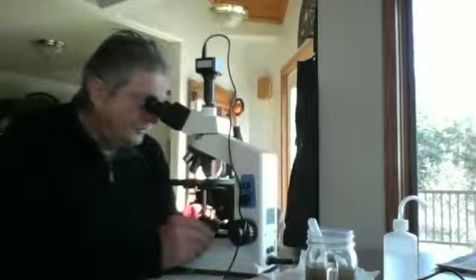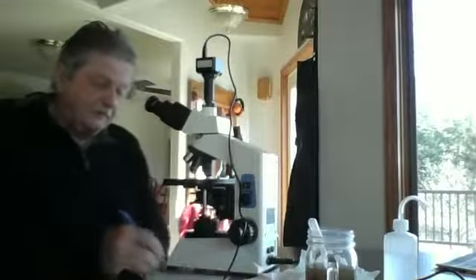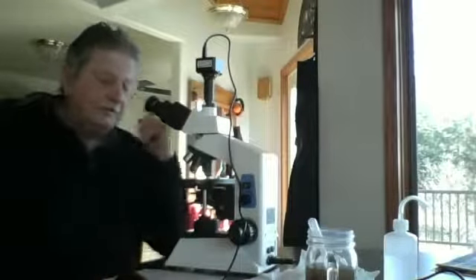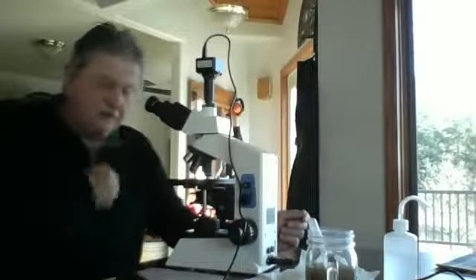You'll have all 3 types of bacteria that you're looking for. Up and down focus in all of these, just to make sure you're getting everything. The flagellates definitely have more movement to them than bacteria, although some cocci are doing pretty well. Okay, so that's the end of the main assessment for compost tea made using Midwest Biosystems Compost on March 18th, 2022.